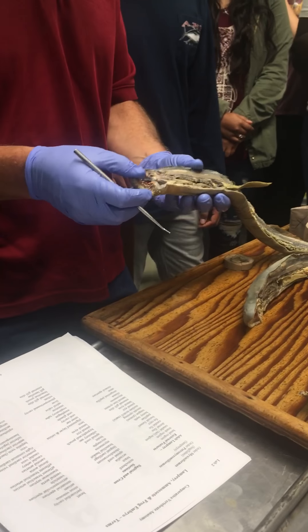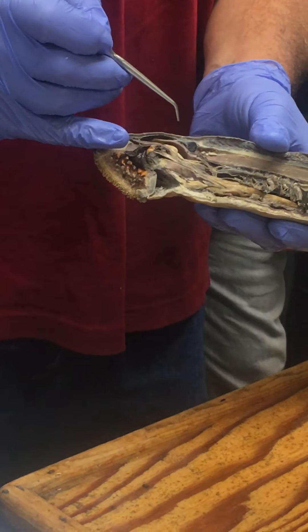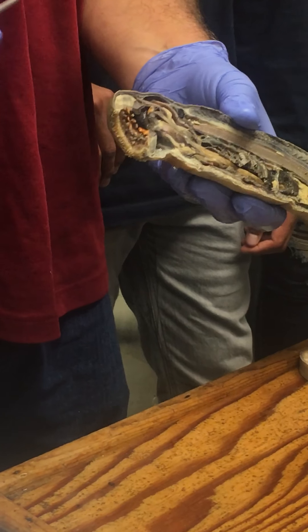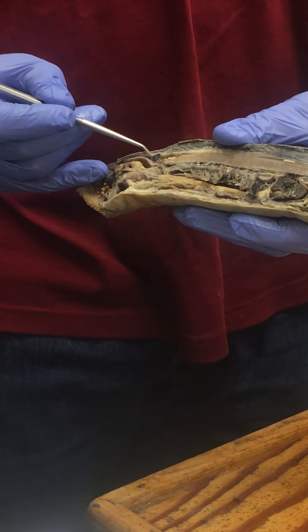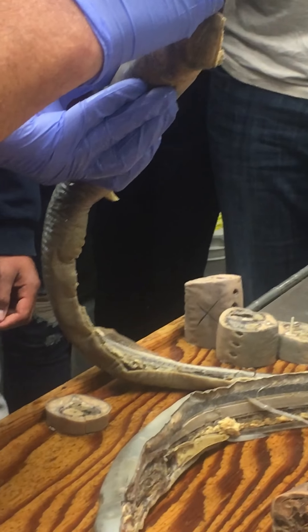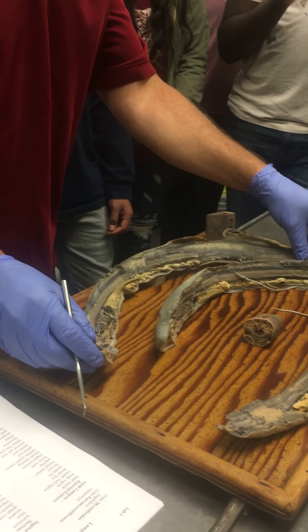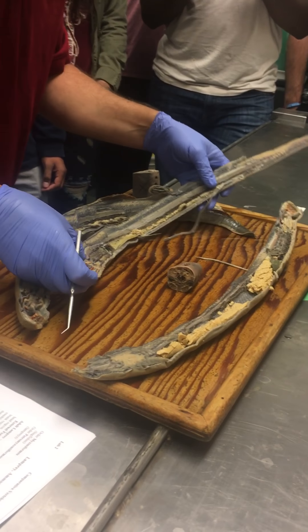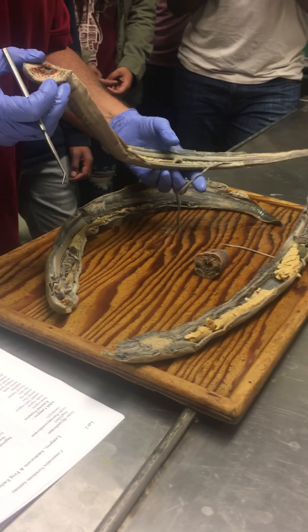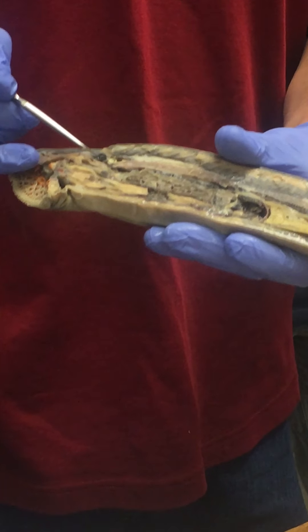The olfactory sac is the nose — it's the actual sensory epithelium of the nose in a sac, right here on this animal. It's a pretty distinctive thing, something that's very easy to identify in a practical exam situation because it's so distinctive. That's the olfactory sac.